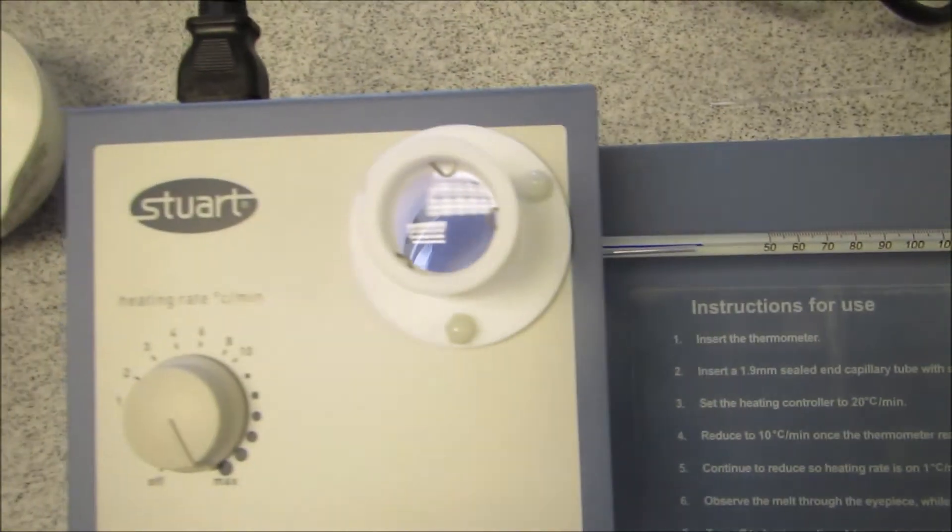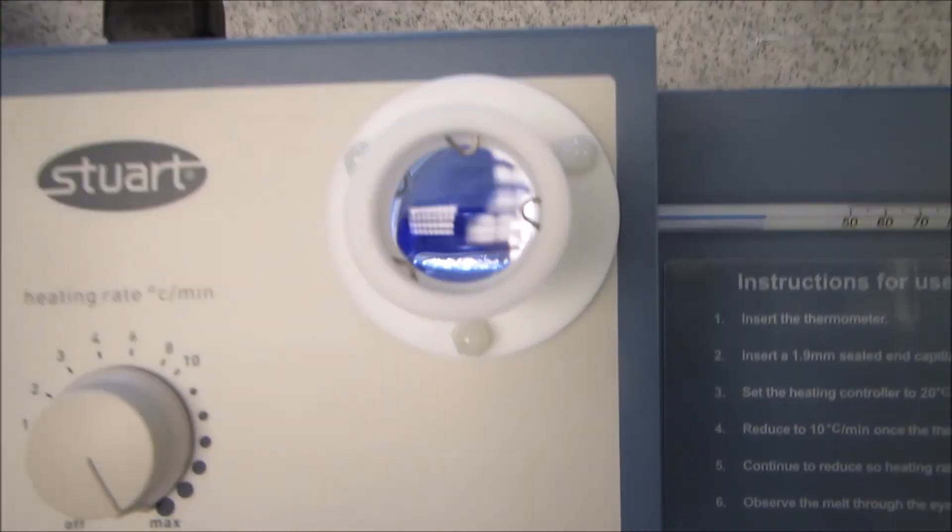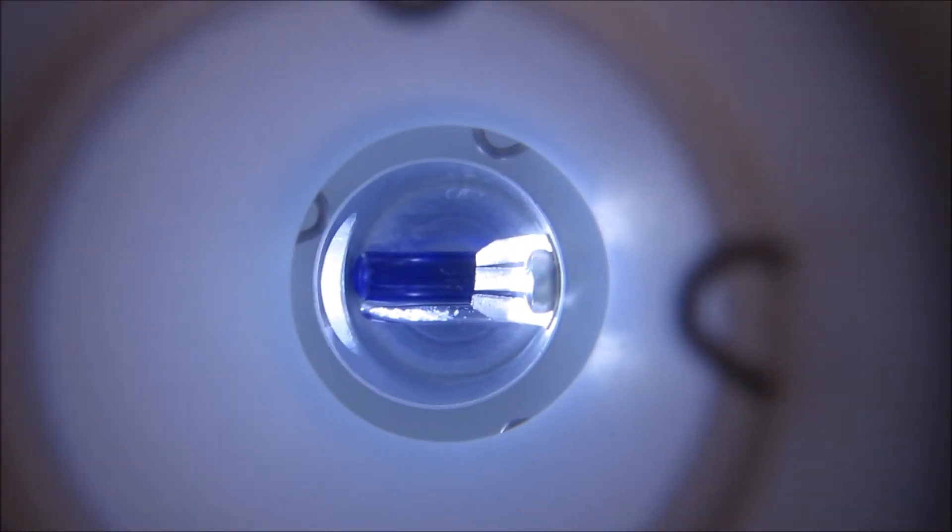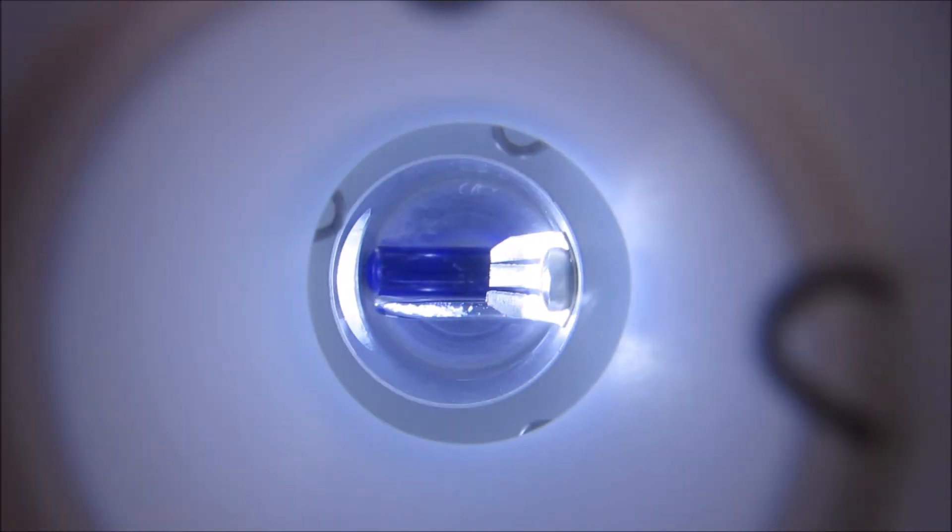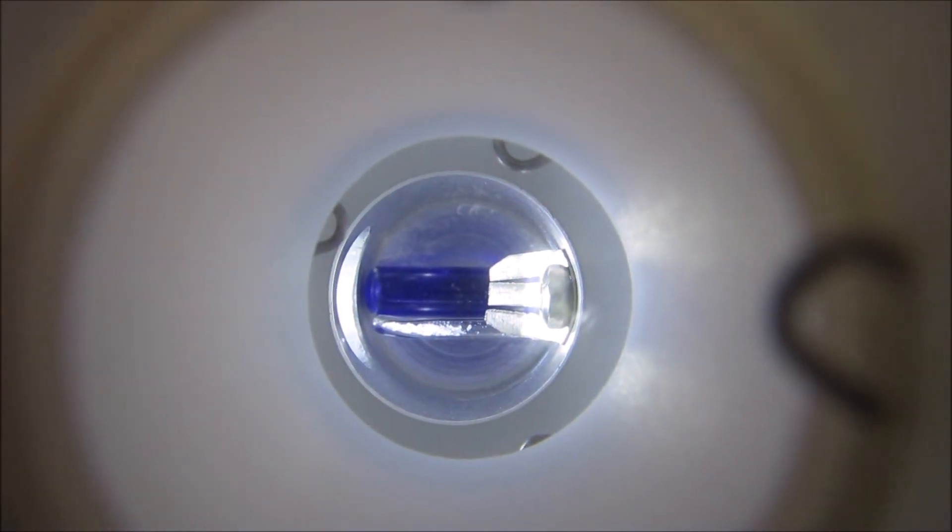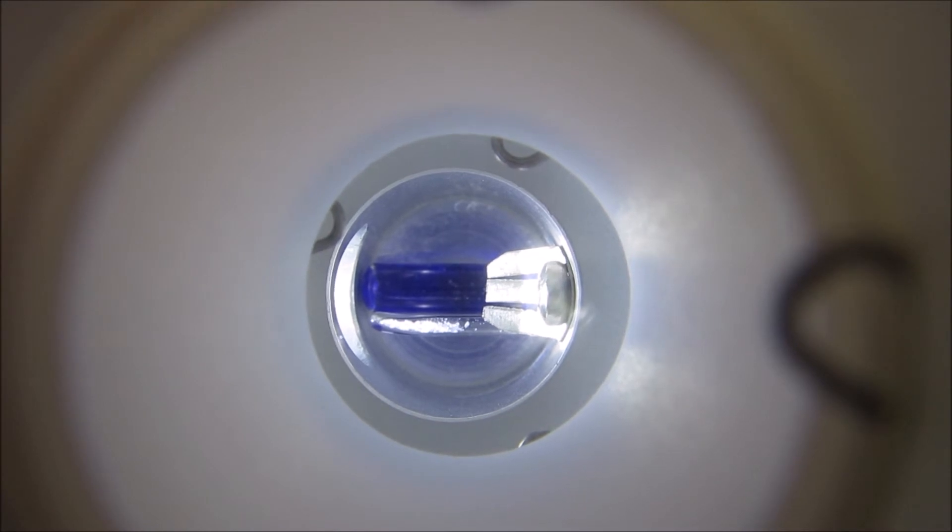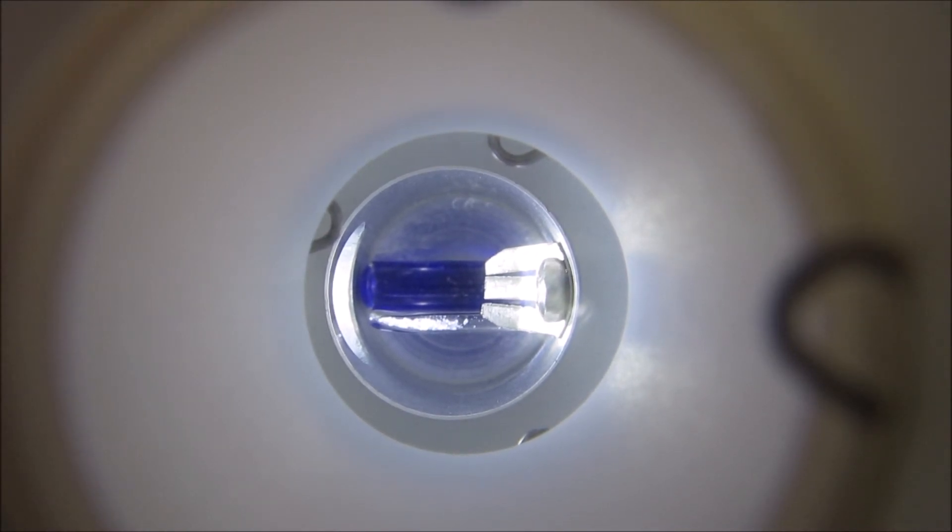So now I've turned it on, it will start to heat up. And then I'm looking for the point at which the white crystals will essentially melt. And you're quite often left with like a little bit of brown liquid, you won't see the crystals anymore.